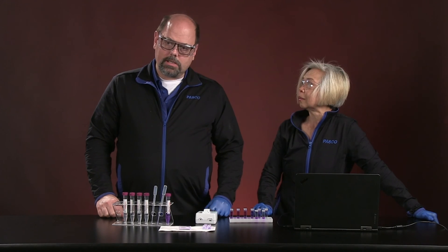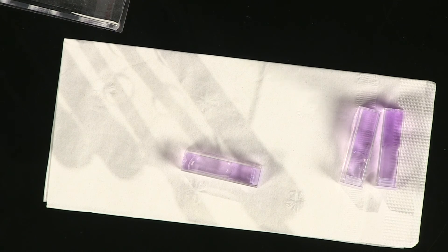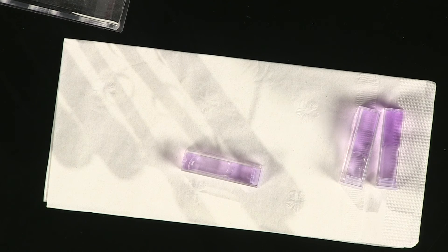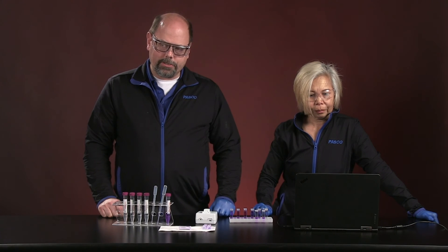Now we're getting ready to add the highest concentration of sodium hydroxide that we have. What's nice about being able to measure these is that you can see changes. If you look at the ones that are on our napkin, they may be difficult to quantify how different those are, which makes little instruments like these a great help in studying these kinds of reactions.